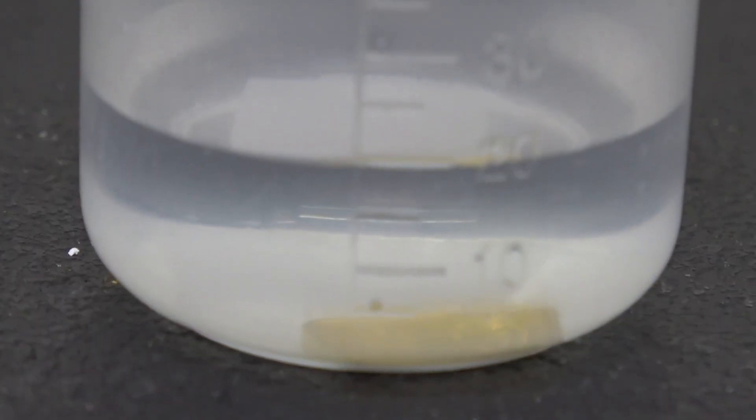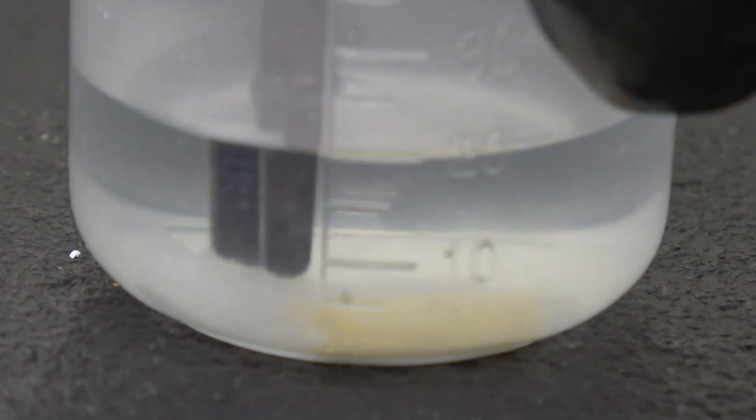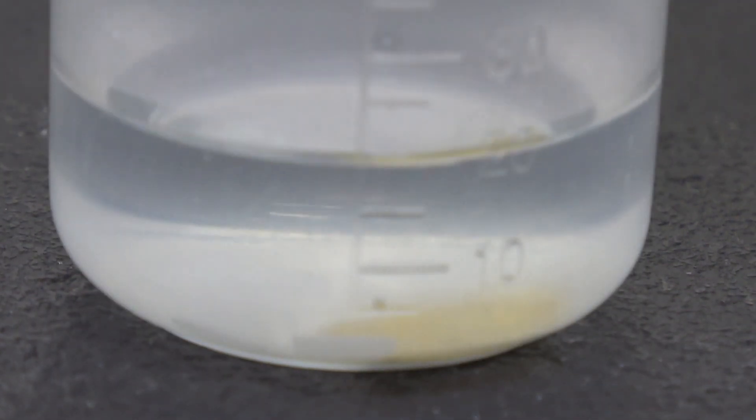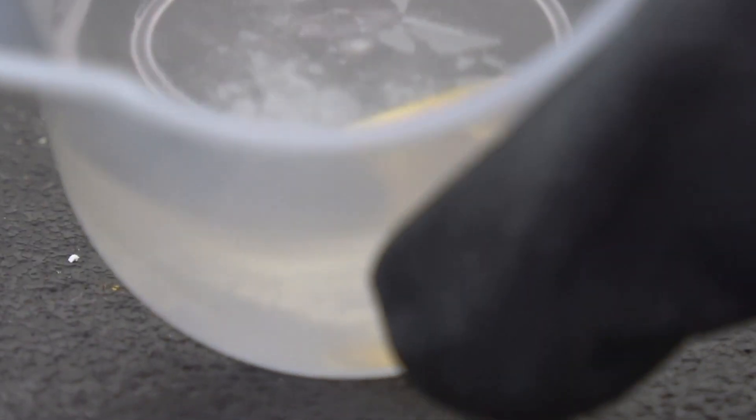Out of curiosity of finding out what exactly it is, I attempted to take the slide out of the beaker, but it turned out to be as fruitless as you trying to take revenge on your ex by stamping on their shadow. I watched this slide fall apart into this snowflake-like substance.